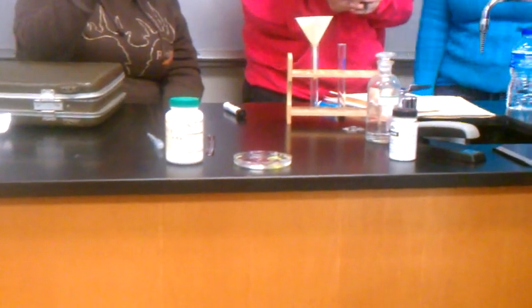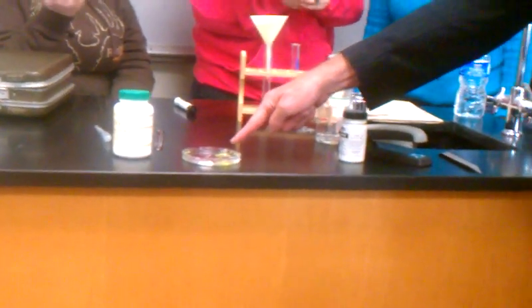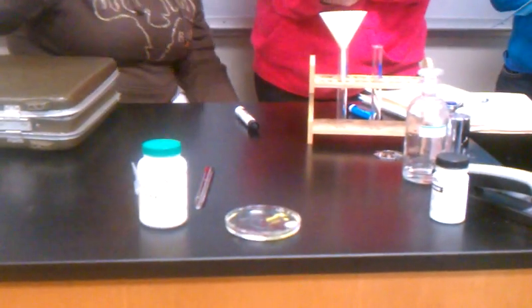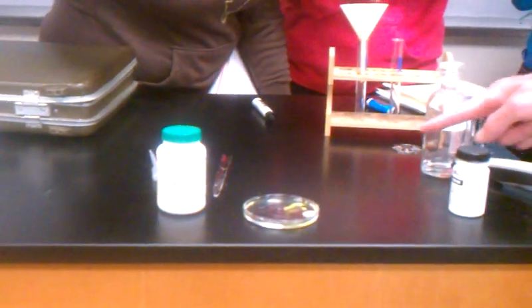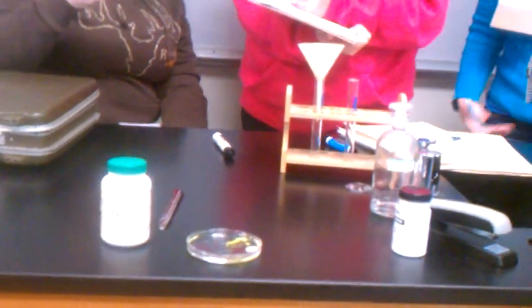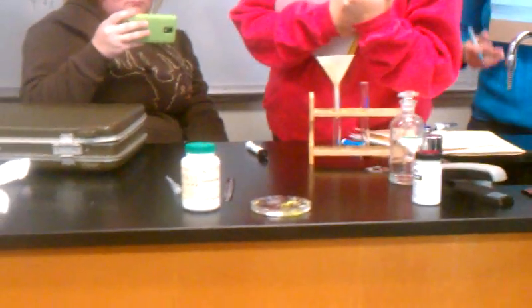Watch what happens as this develops. You can see that it's acting kind of like an Etch-a-Sketch and drawing a yellow line, kind of. We'll just let it sit there and develop. It keeps continuing forming this little line — a crooked line, but a line. Interesting, huh?